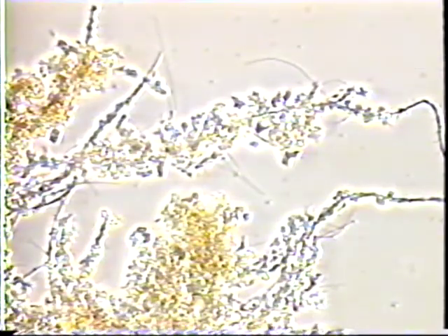Shown here is Nostocoida limicola 3. It is the thickest of the filaments. In plants treating domestic wastewater, the Nostocoida are Gram-positive, but in some industrial wastewater systems, they are Gram-negative. The most significant feature of the Nostocoida is their Neisser-positive reaction.